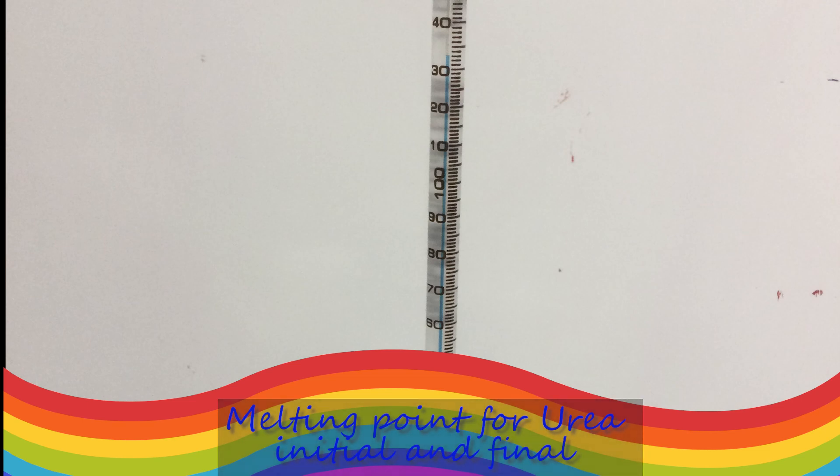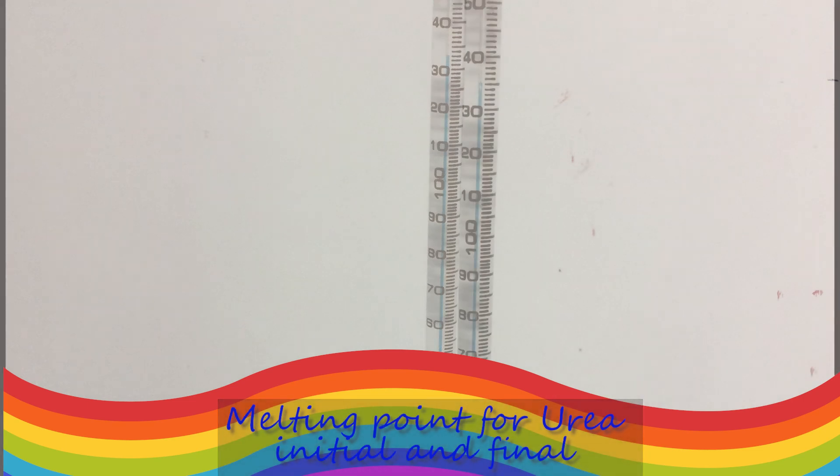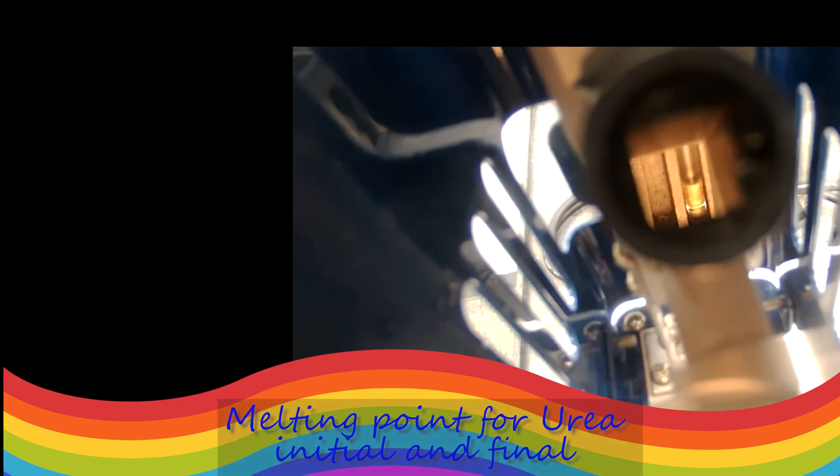The melting point for this one started slightly earlier, but still is within the range. So the correction is going to be slightly different. I will have the screenshot of the thermometer, the temperature for you and you record the exact temperature for initial melting and then for final melting, which would be labeled for you.